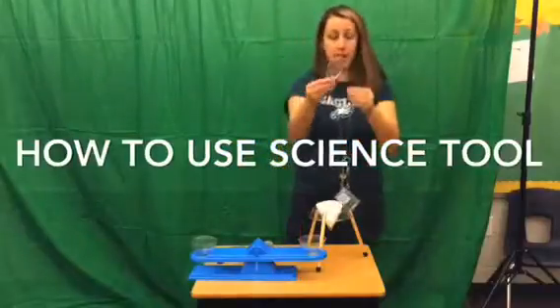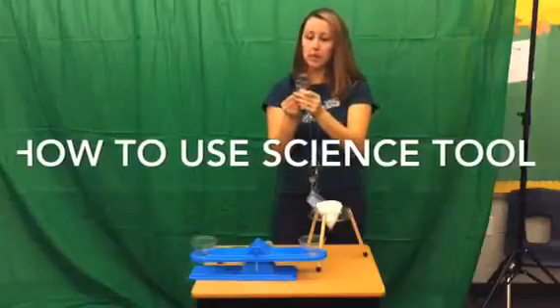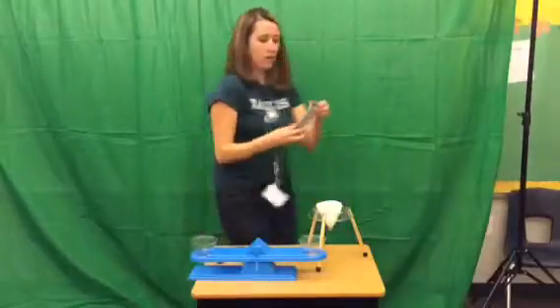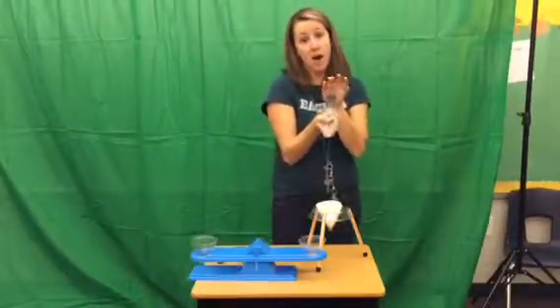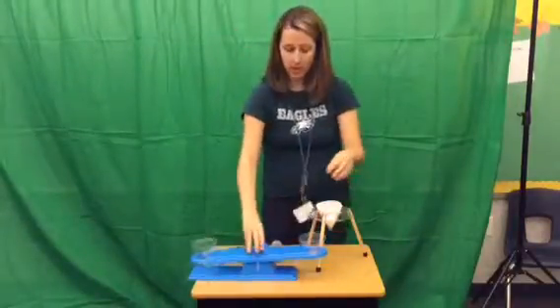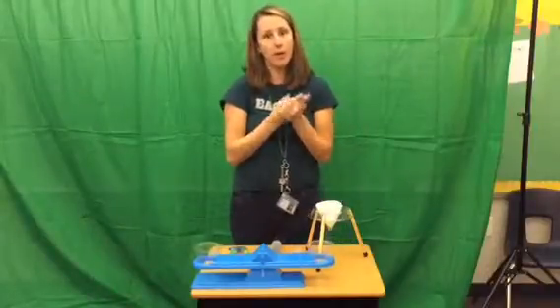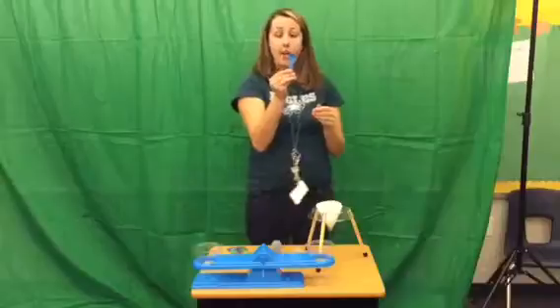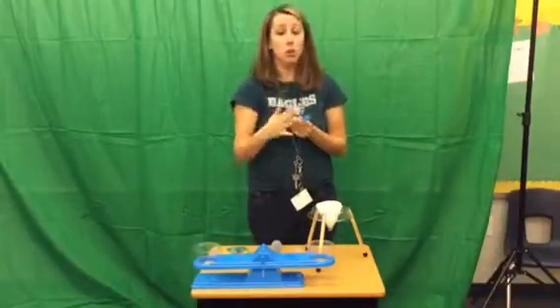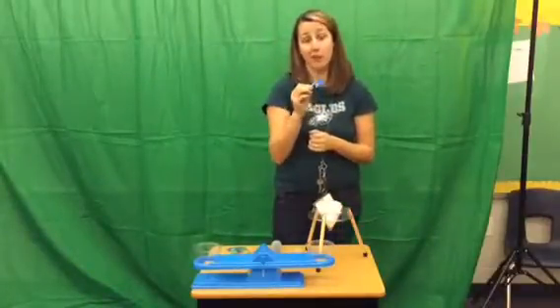Another tool we're going to use is a hand lens. We're going to use that to inspect different materials up close so we can see what they look like with a magnifying glass. We also have a pipette here. We're also going to be using our syringe again, and I'm going to model how to use that again for you. We have our balance right here, and I'm going to show you how to use that and how to make sure it's zeroed and how to actually measure and use that. I also have my measuring cup here, and we're going to learn how to measure with that. We don't want to put too much of a material in it or not enough material, so I'm going to model how to do that.